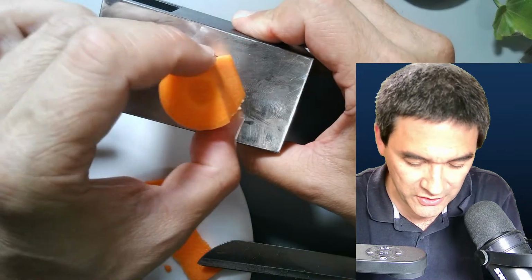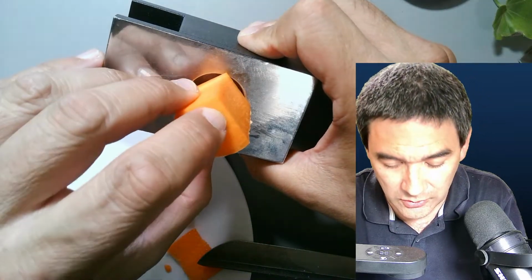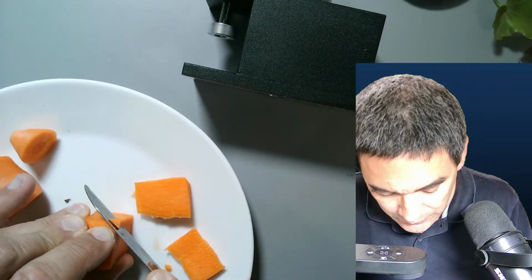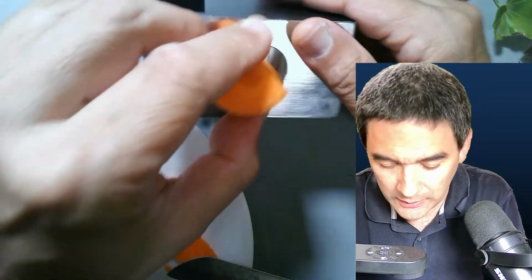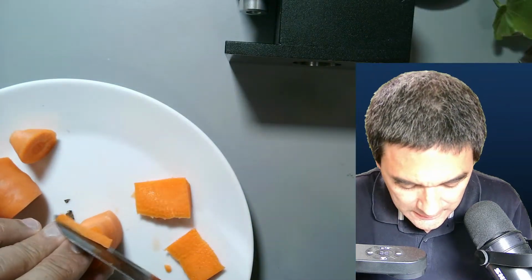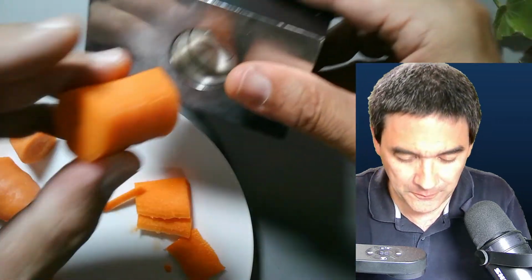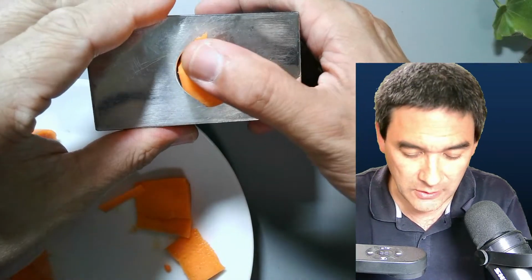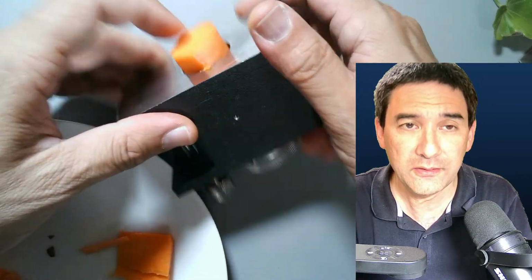Okay, we're slowly getting there. Okay. So I'm going to cut off. I know this is not entirely round, and it doesn't touch all of the edges quite well, but I hope you get the idea. Okay, slowly we're getting there. Okay, here we go. Yeah, see, it seems to fit in here.